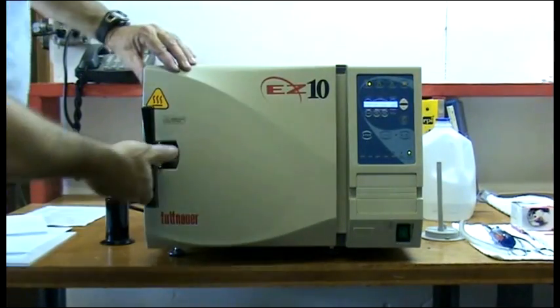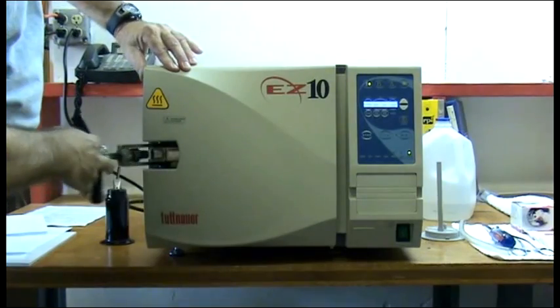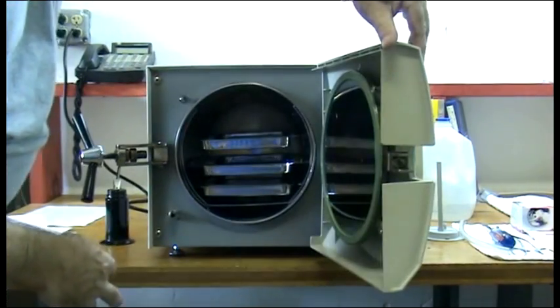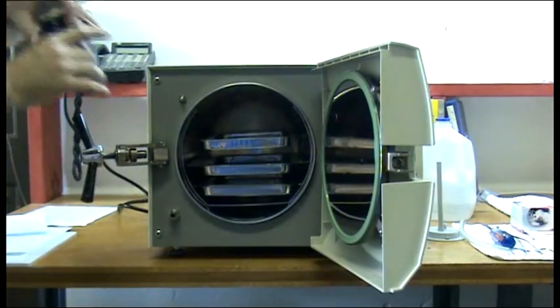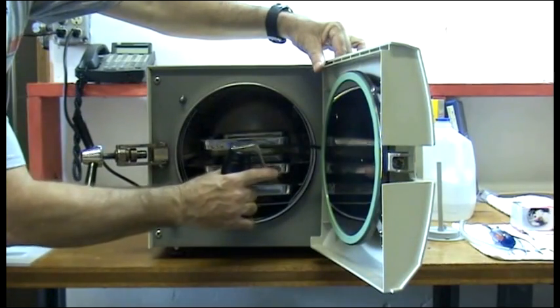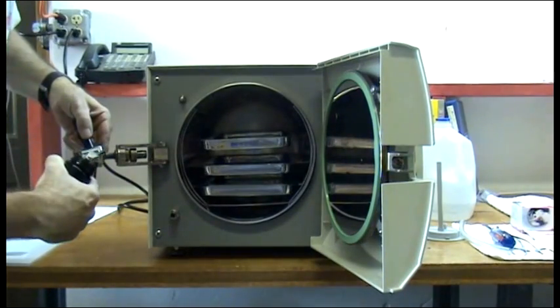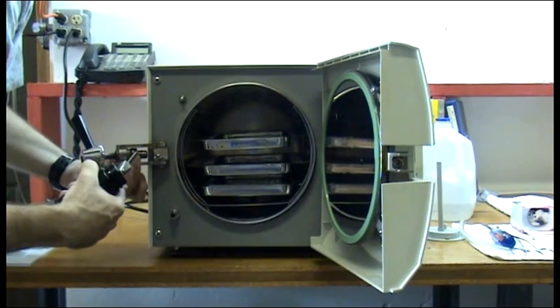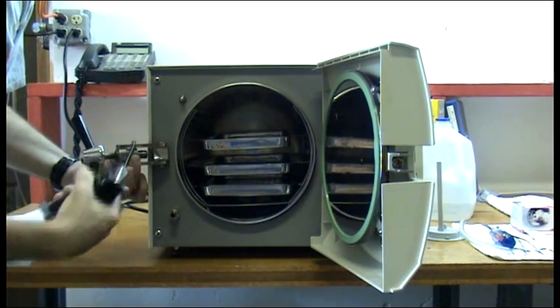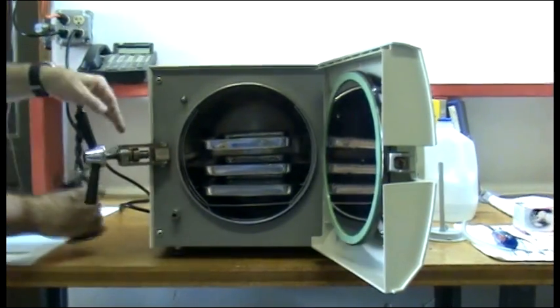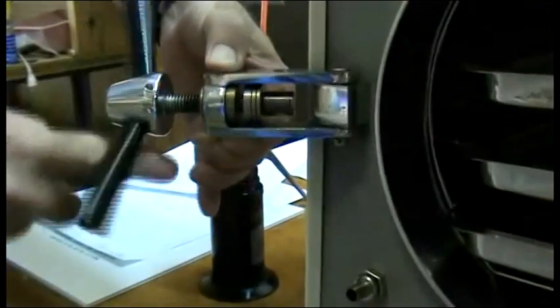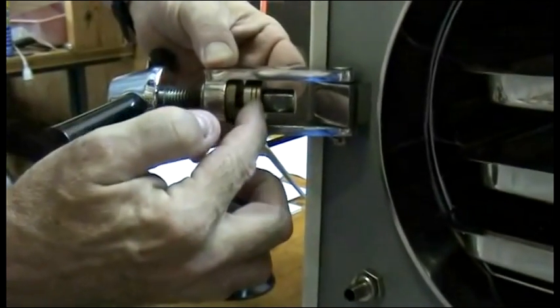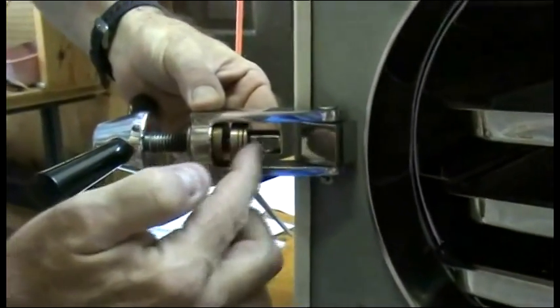Periodically, it's advised to oil the door hinge and handle. A few drops of oil on the door hinge, on the thread, and especially between these two plates right here. Oil, spin in, spin out. These plates right here are essential to oil; one plate should spin.